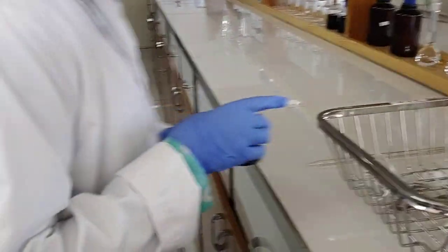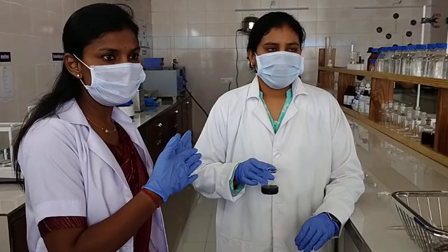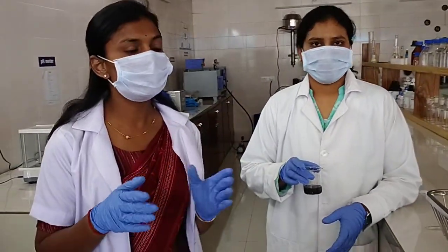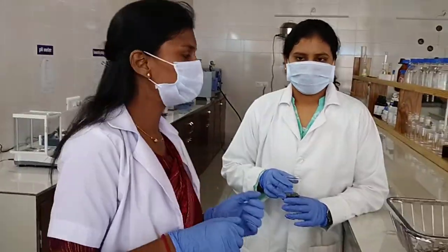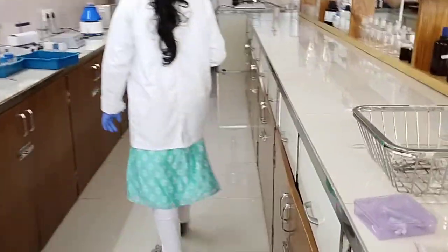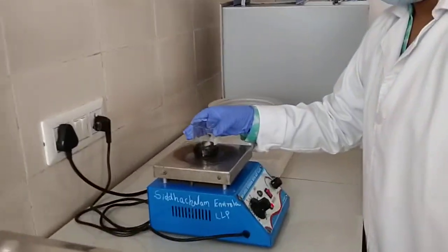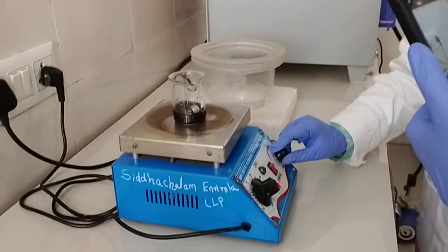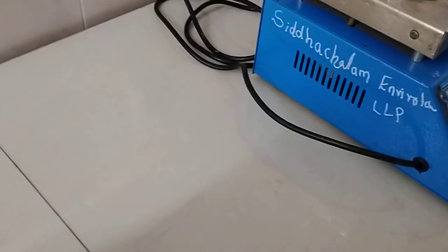Today we are going to explain two things. First one is chemical and second one is green. So while it is taking time, meanwhile Aisha ma'am will explain the green synthesis also. So focus on the complete reaction or synthesis procedure. Okay? Aisha, you need to write down ice cube, after some time now.